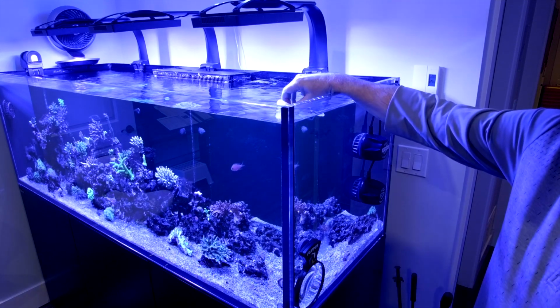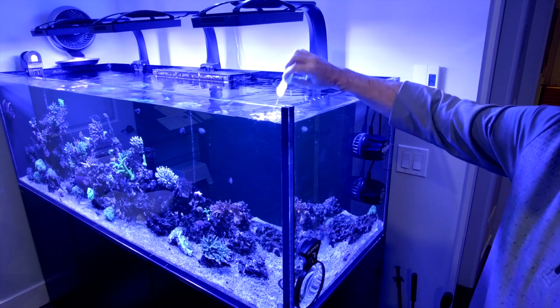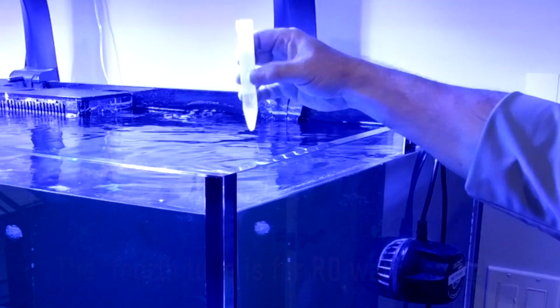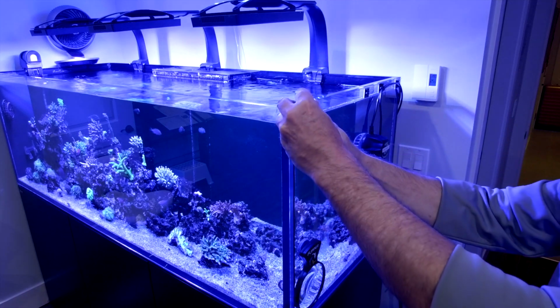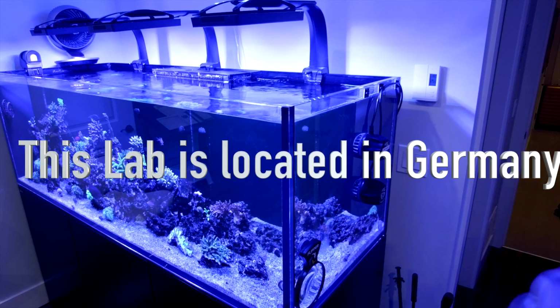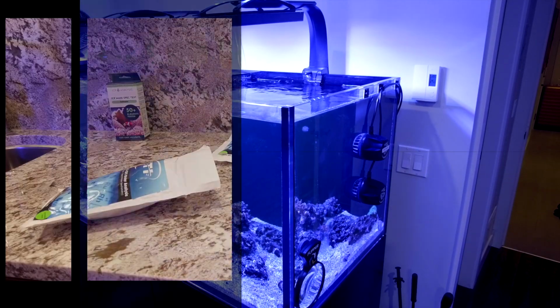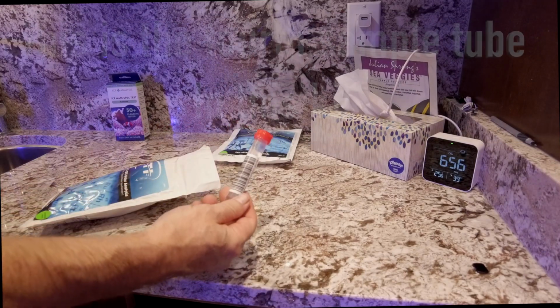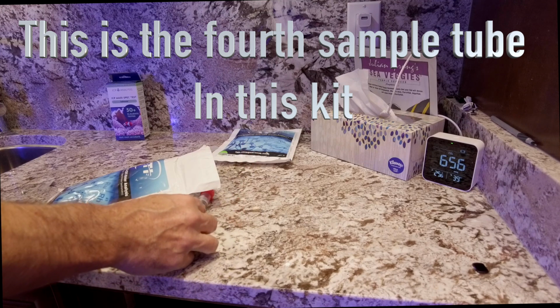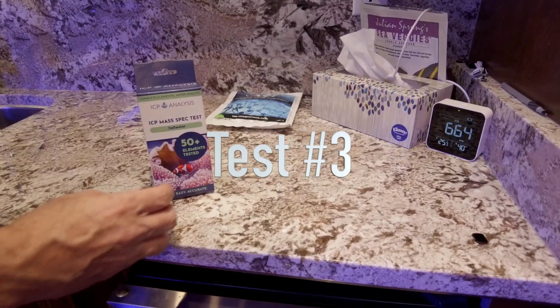Now it did come with an RO sample, which I'm probably not going to use because I've already sampled my water and I know that it's good. We're blessed with nice clean water here in Canada. There we go, number 3. So we'll get this one sent off and move on to test number 3. I did decide to take an RO water sample anyways. I'm already paying for it, so we might as well send it off and see what it says.